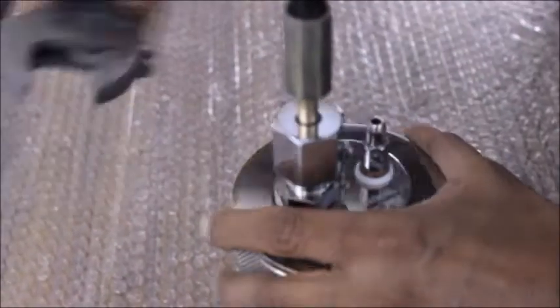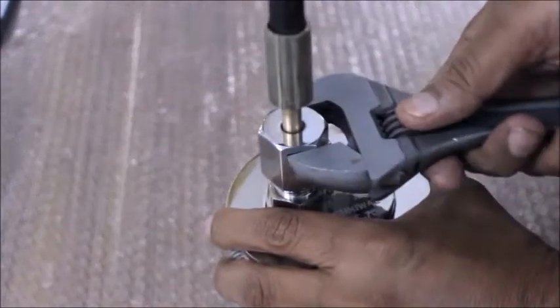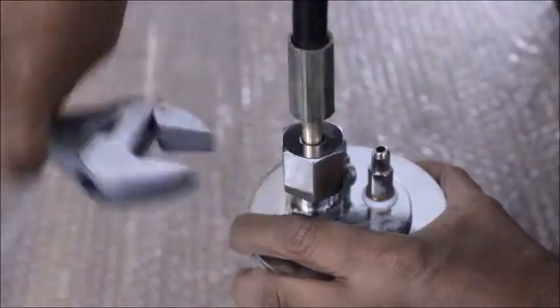Once the bomb is filled, use a spanner to disconnect the pipe. You will hear a hiss sound. That sound indicates the release of oxygen which was present in the pipe.